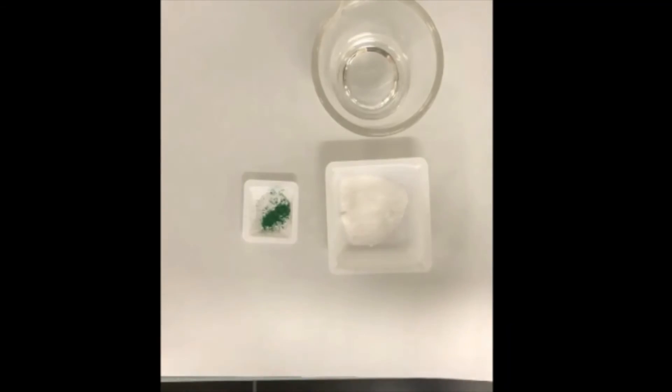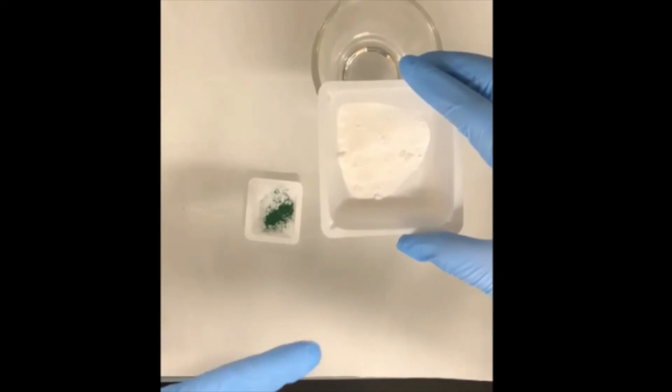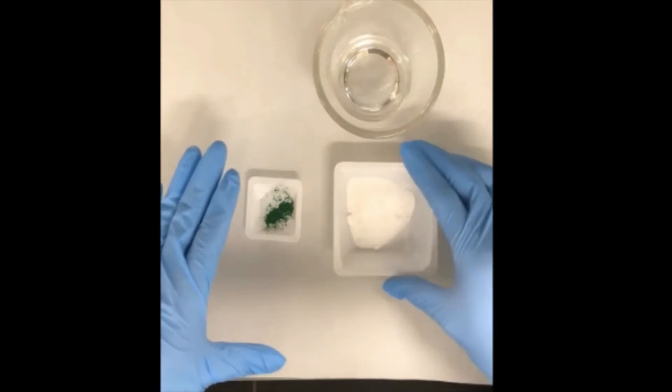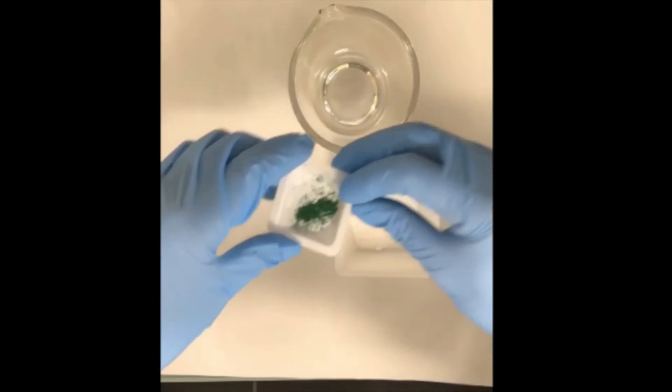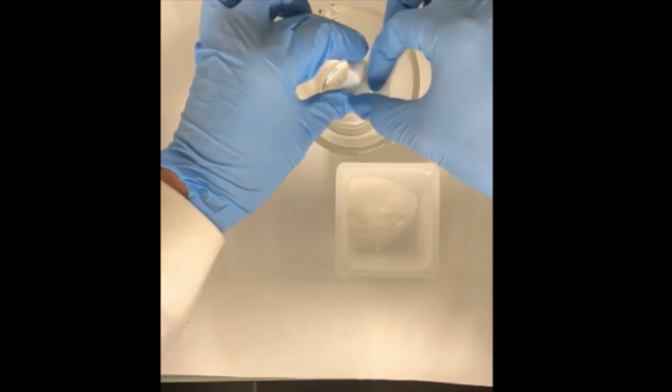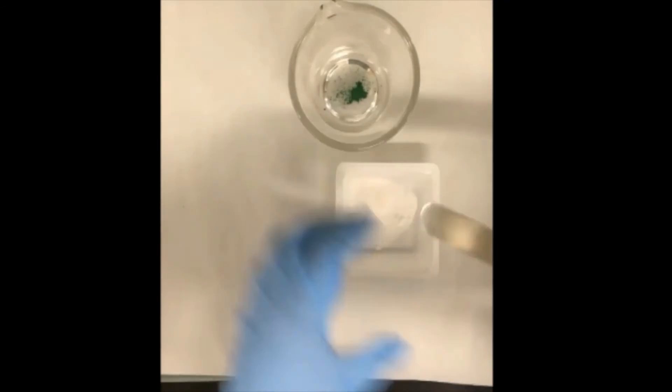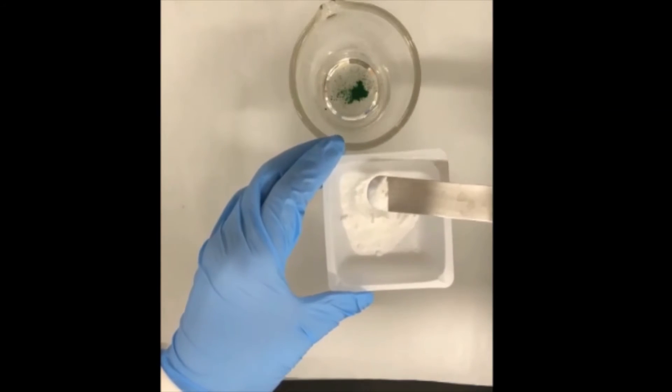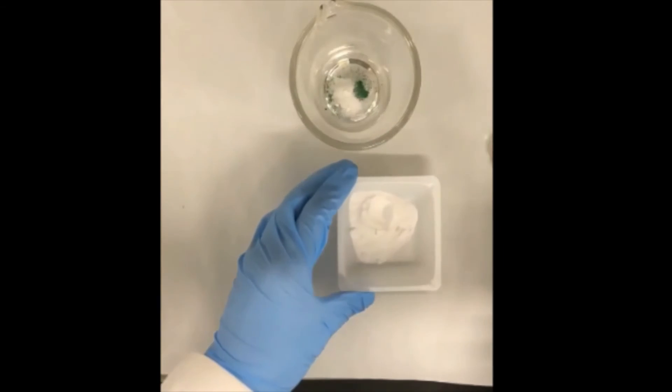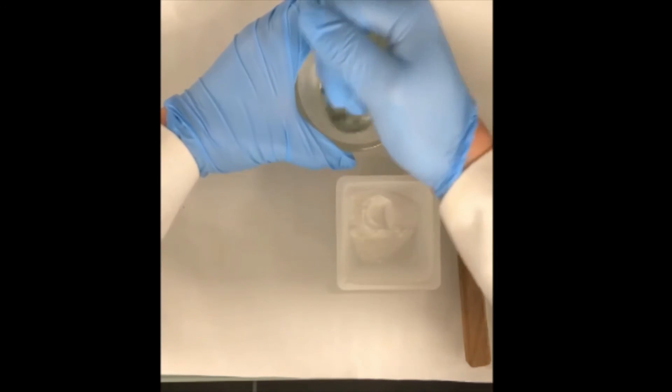Now I'd like to show you example of the powder with powder. The food green color is used as a small quantity while the lactose is used as the diluent which is in the larger amount. We will get started by putting the food color inside the mortar. You can simply just flick the back of the weighing boat to collect all the powder inside the mortar. Next we will add approximately equal amount of the diluent into the mortar as well.